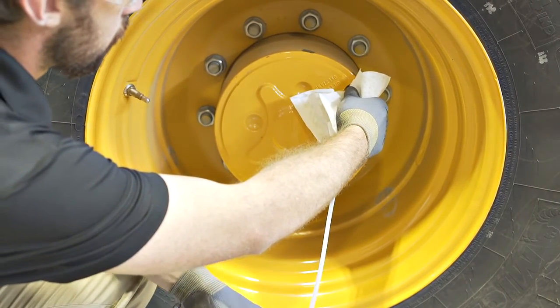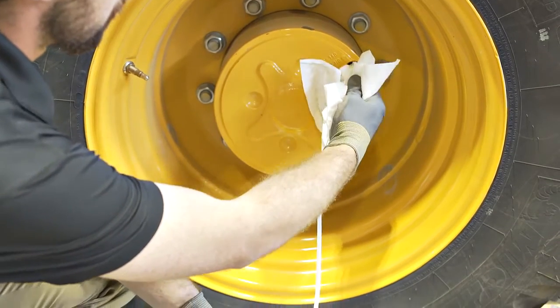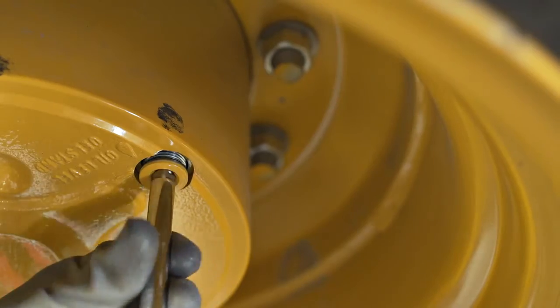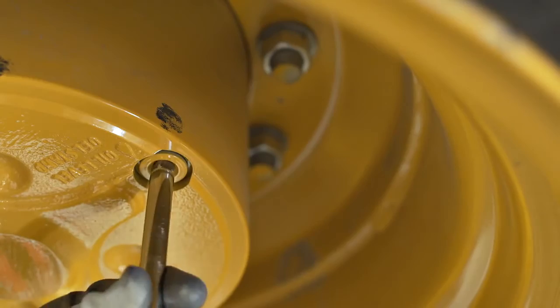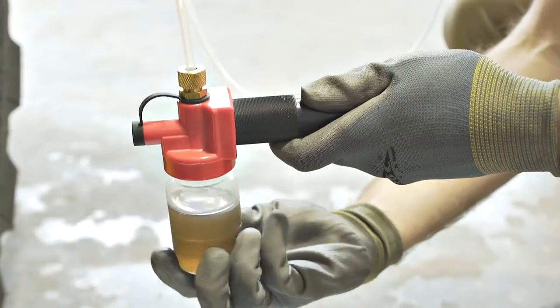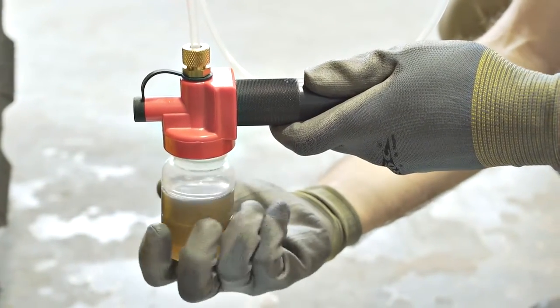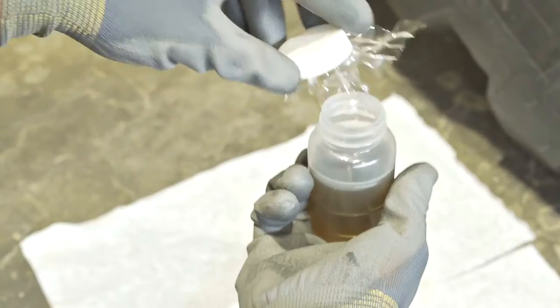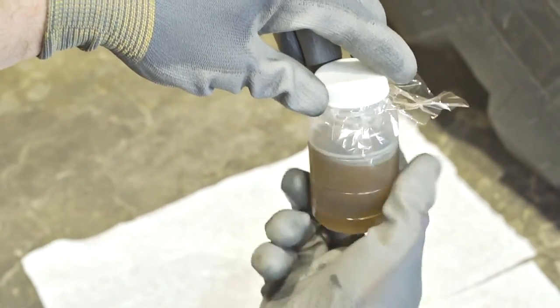When sampling from a reservoir, make sure that the sample is not obtained from the bottom of the oil compartment where contaminants accumulate and avoid scraping the tubing along the sides of the tank or reservoir. Note, if oil enters the pump, disassemble and clean it before taking the sample. Do not reuse tubing.